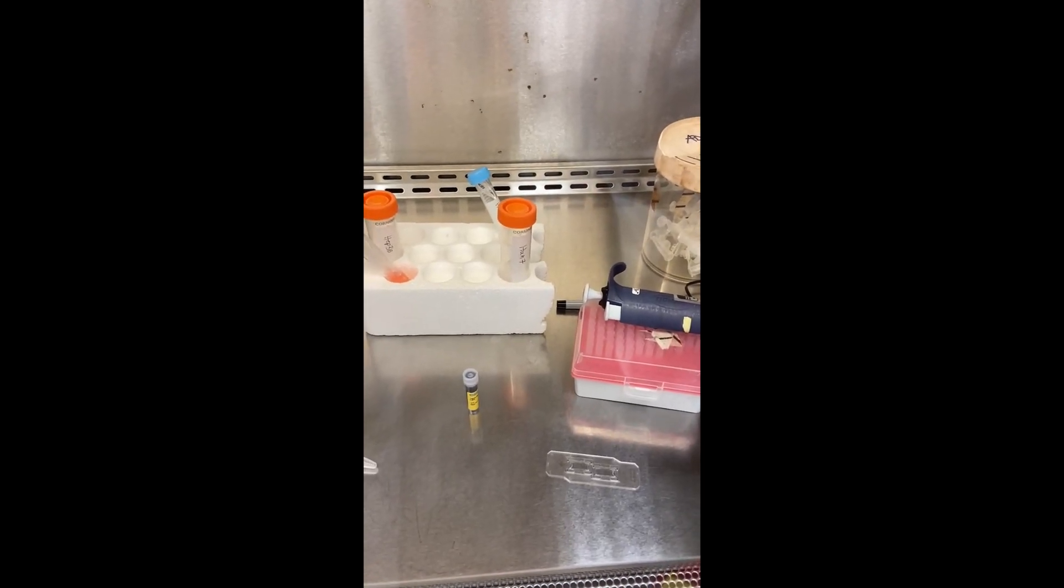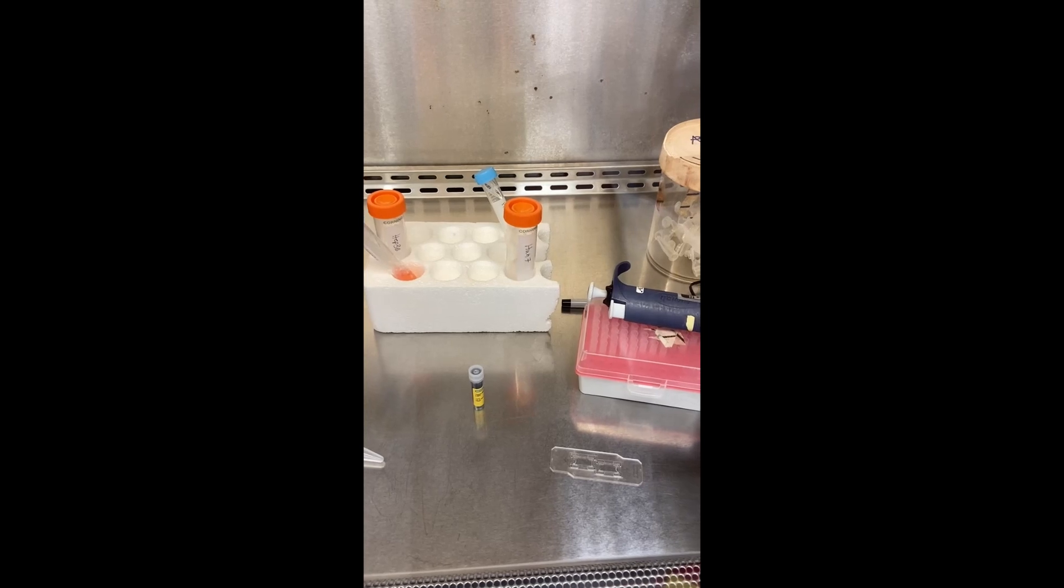Hi everyone! Today I'm going to be talking about how to use our Bio-Rad cell counter.